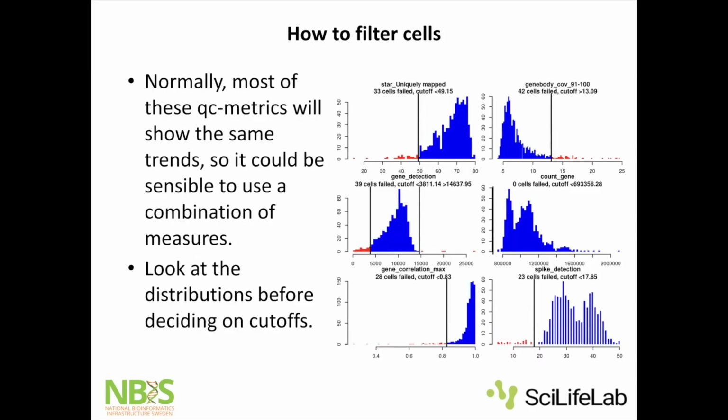Then how do we filter? I would say look at the distributions. That's my best suggestion. To find stuff that deviates, like if we have the mapping stats, I see this tail, I remove it here, or I have number of detected genes. Here I probably have my doublets and my failed libraries. So just visualizing the data and deciding cutoff is probably the best way. We can try to do some automated detection based on the distributions and so on, but you should always look at it also.